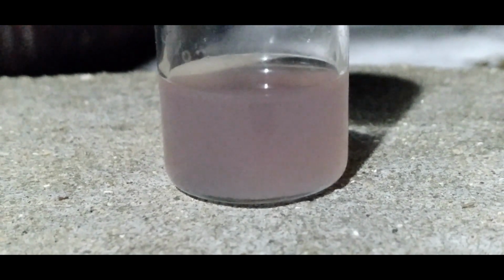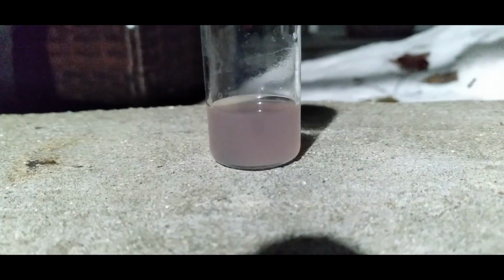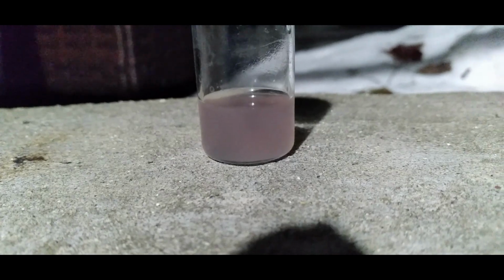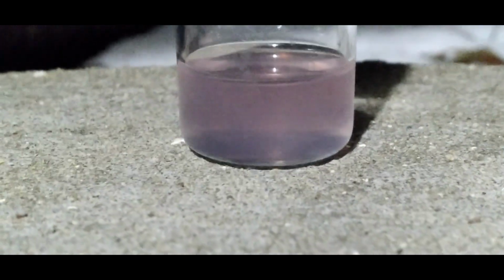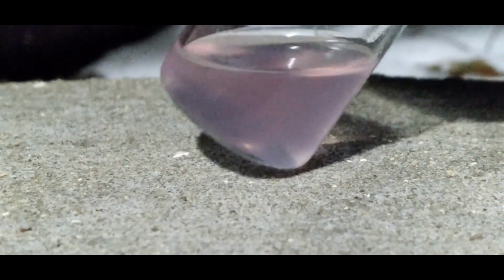The solution still looked a bit turbid, so I decided to centrifuge it once more, and sure enough, it removed the rest of the magnesium hydroxide. This is the final result of the solution, and it appears as though there's either a low yield or it's just really dilute.